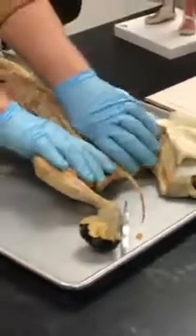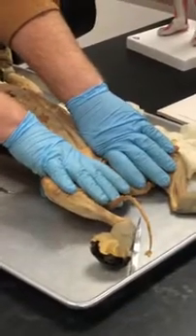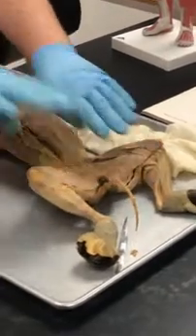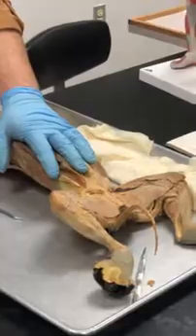Okay, so let's talk about the legs. But in order to do that, there's a bunch of muscles here, and I think you guys can do this. You saw it with the other group. They kind of picked up pretty rapidly with it. It's easier if I kind of show you what's going on. Okay? So I'm going to refer back and forth to this.